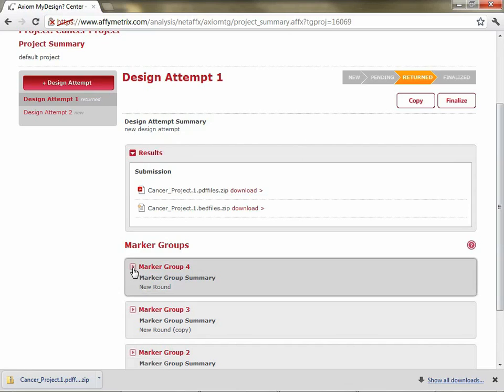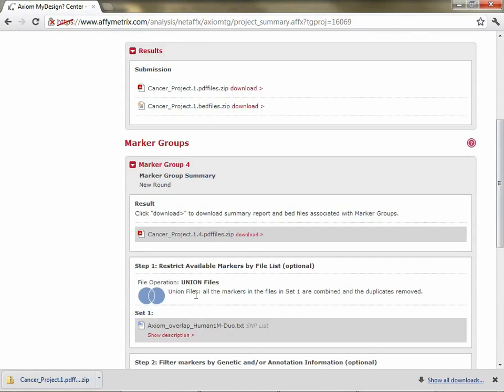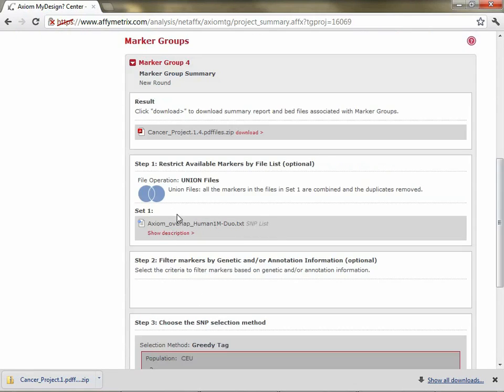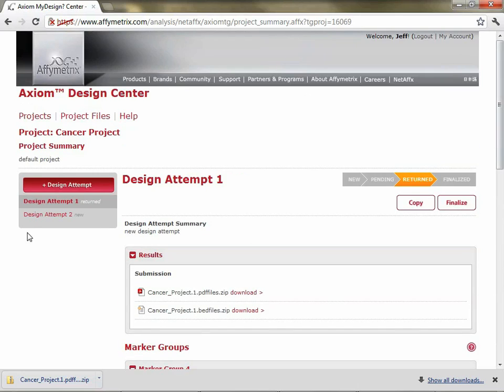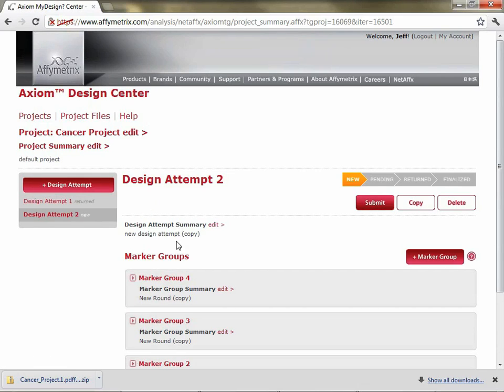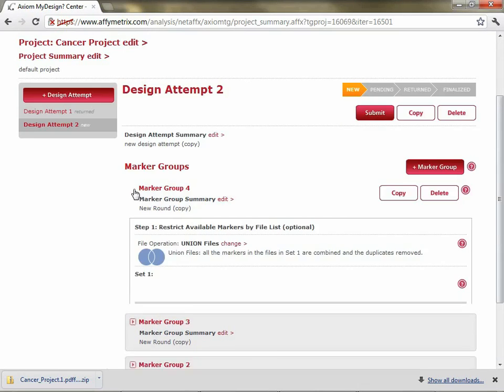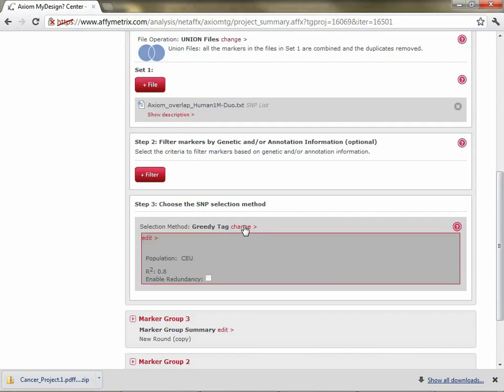So here in marker group 4, this is still the original design attempt we were looking at, design attempt 1. If you look here, there's no way to edit our functionality. We've picked SNP set 1. I want to change this, for instance, to best tag, but I can't edit it. Now that I've made a copy, if we go to design attempt 2, our results section is missing because we don't have any results for this one yet. And if we open it up, you can see now we can choose to add files, we can add filters, and we can change the marker group selection method.